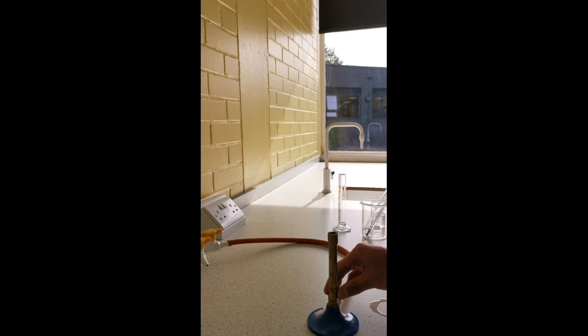When you're lighting your food on fire, you want to use the blue flame. So you want to open this air hole, and you can hear it. The flame is now roaring. This blue flame is what we use to heat things in science.